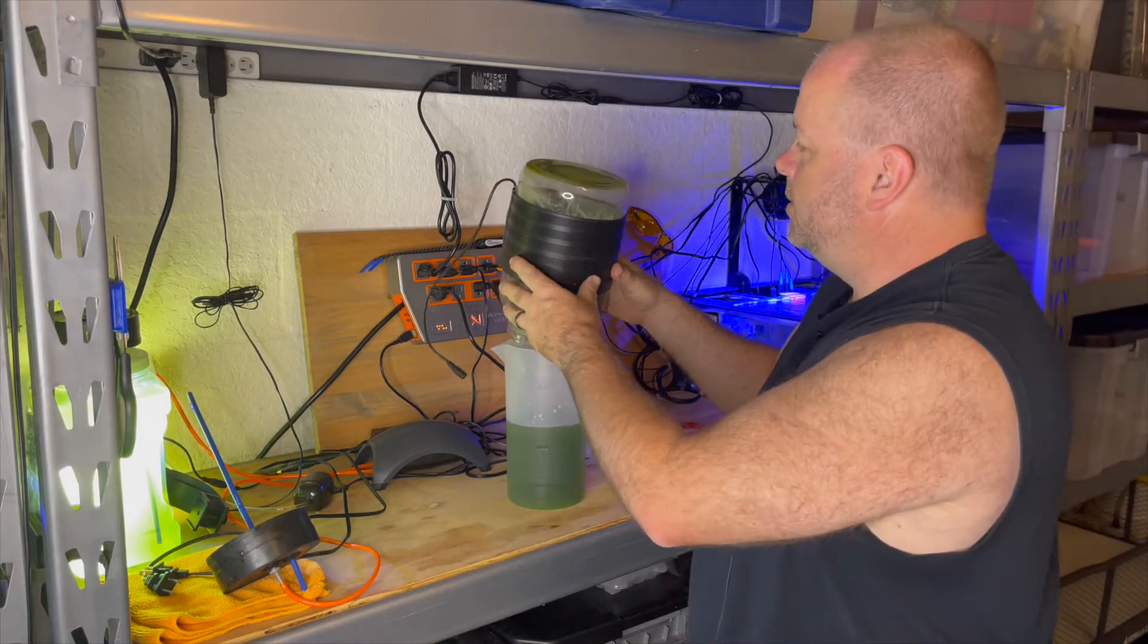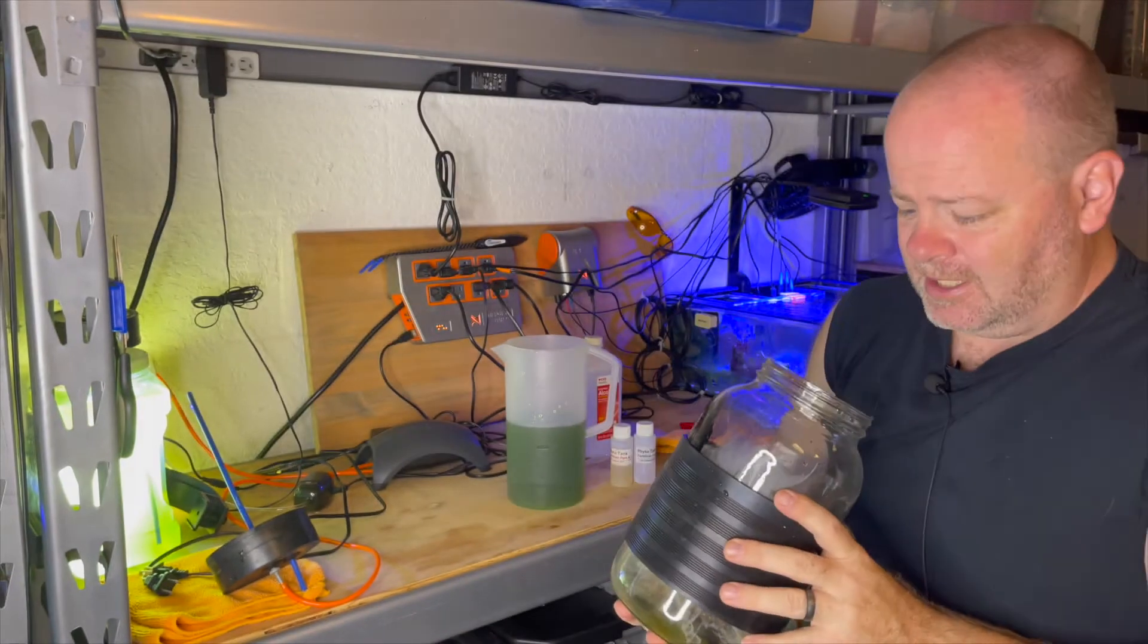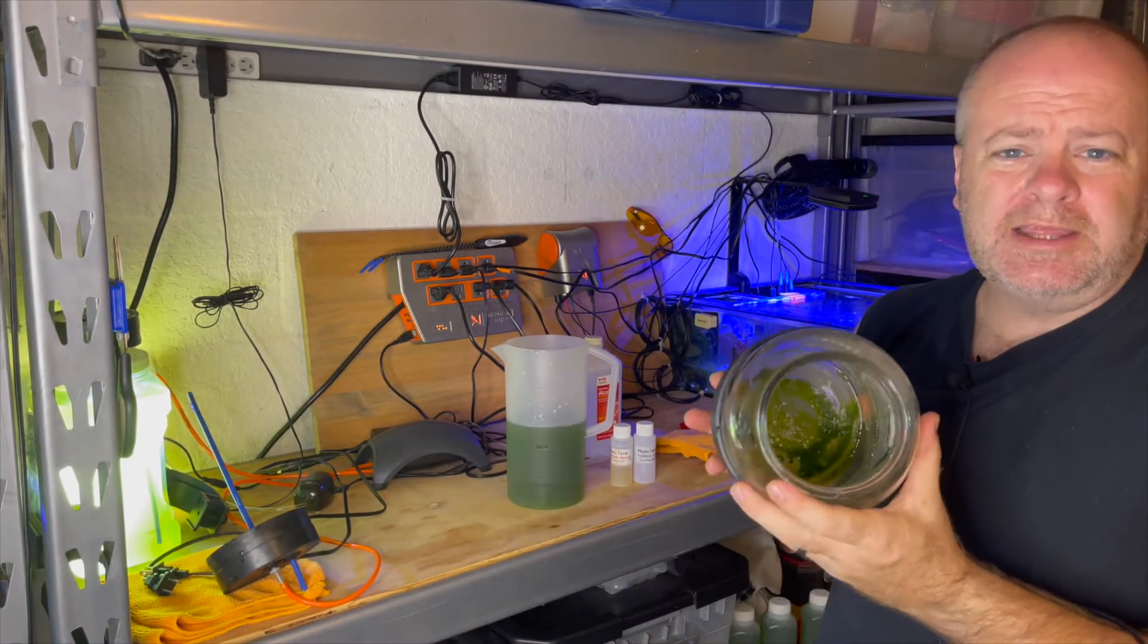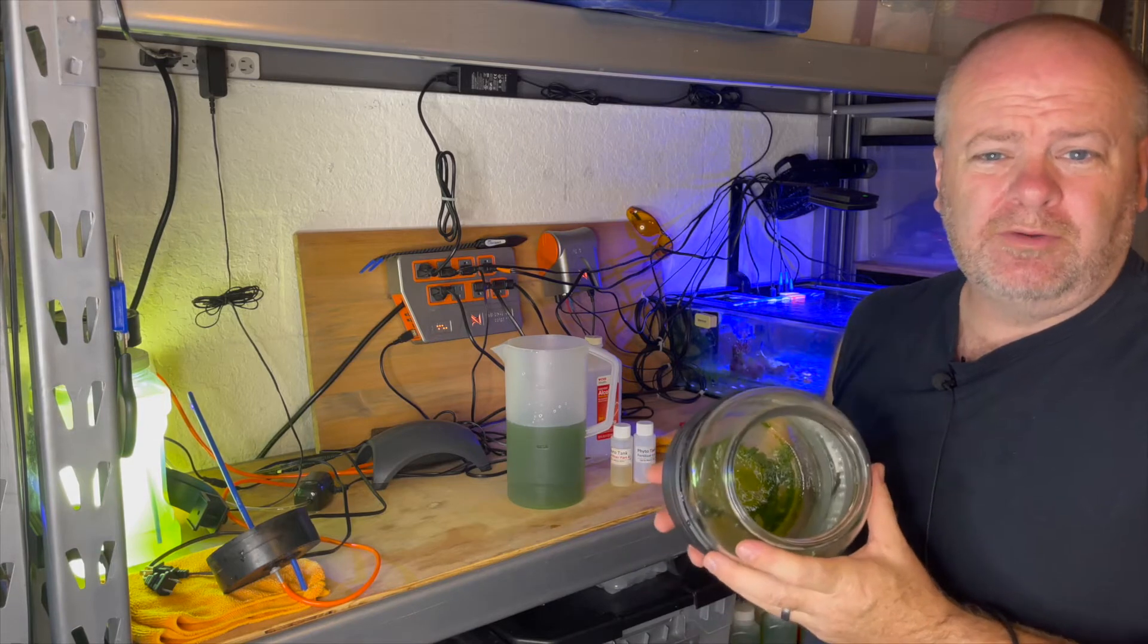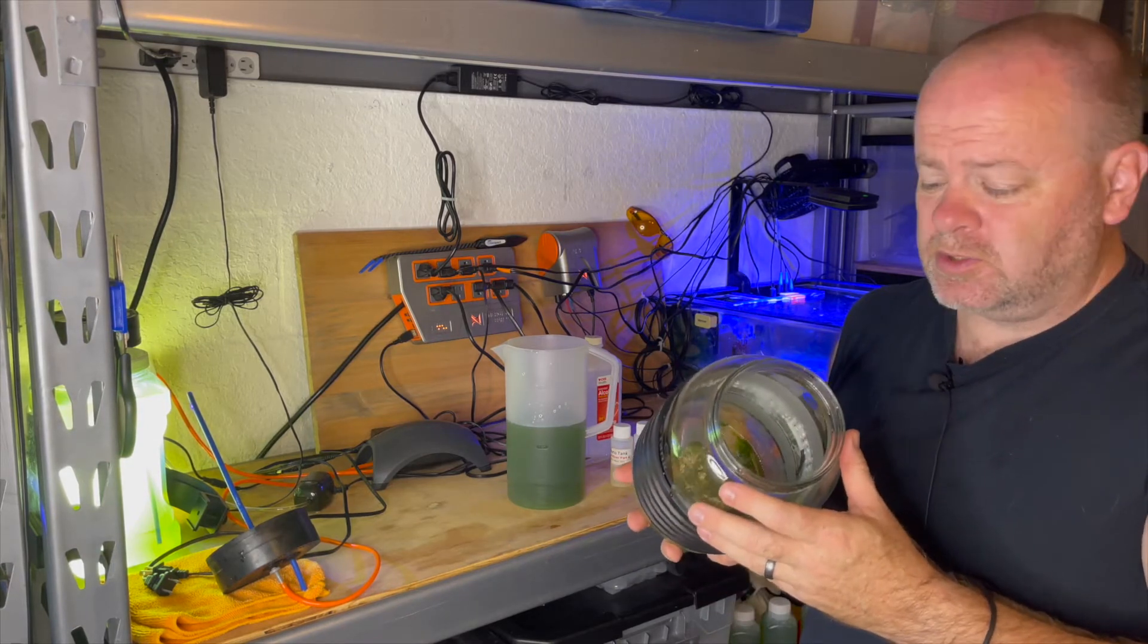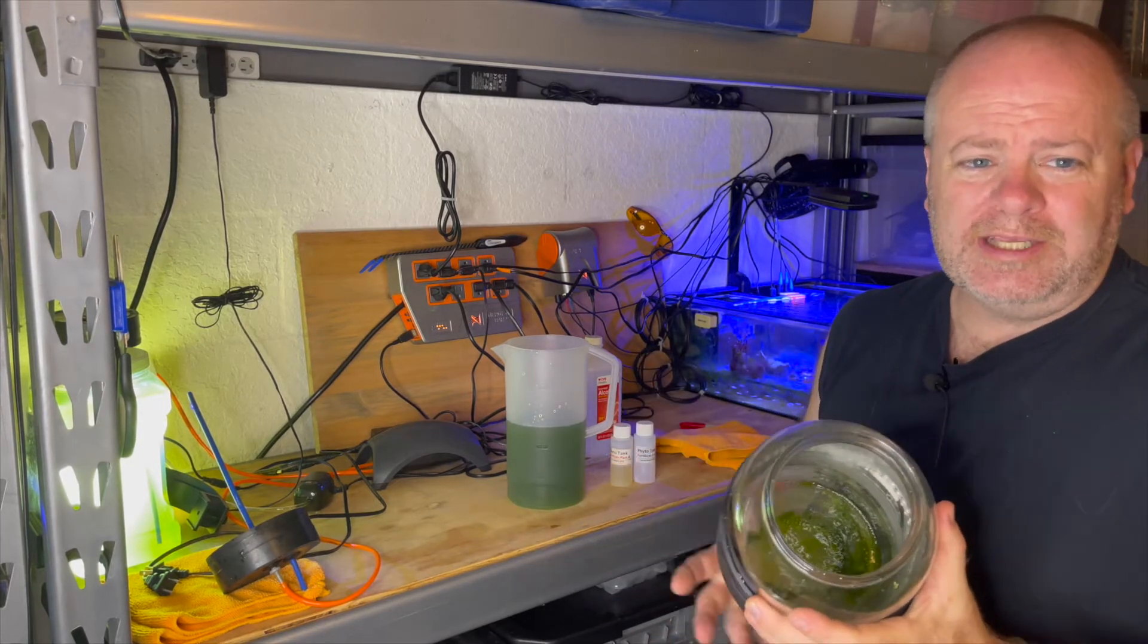So I'm going to take this. You can see that there is quite a bit left at the bottom. That stuff, you know, if you want to take that and put it right into your aquarium, you can do that. That's usually what I do. I put a little bit of water in there. I swish it around and then I dump it right into my aquarium. And that just makes that it's not a waste.